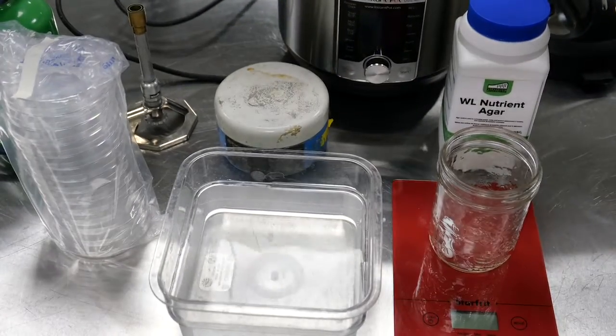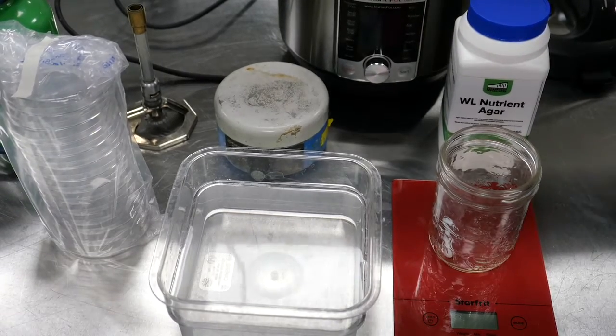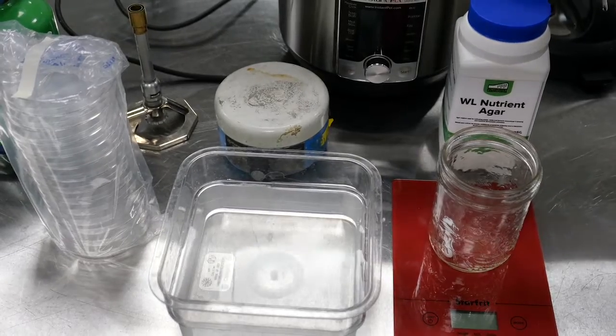We need a device to sterilize in. Here we're using a small model instant pot. If you have the bigger instant pot, even better, but this one's going to work great.